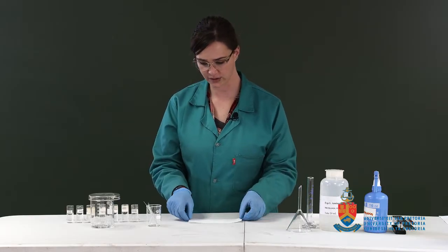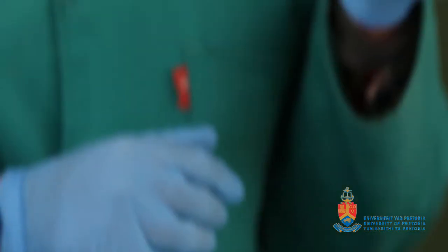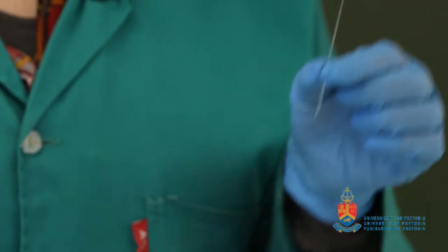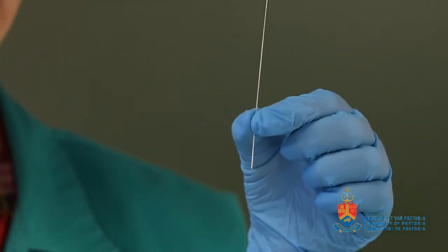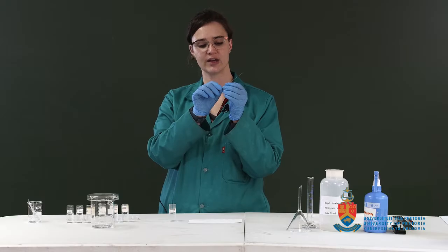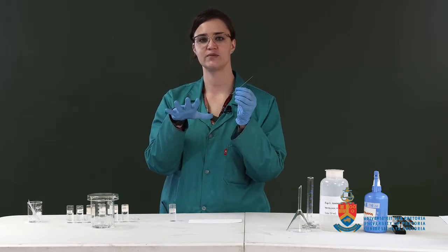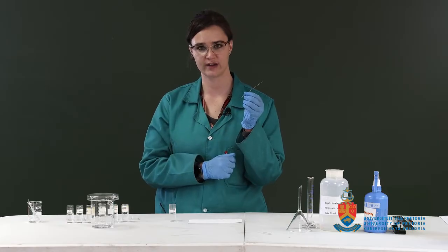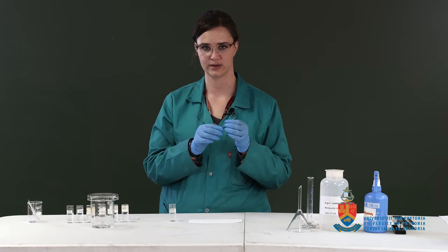Okay, so what you're going to do is you need to use a capillary tube. When you use a capillary tube, you need to make sure that when you spot your amino acid, you hold the capillary tube straight up and down, because if you hold it at an angle, when the amino acid comes out, it's going to spread, which is going to make it harder for you to determine the RF value, and it may also spread into one of the spots next to it.